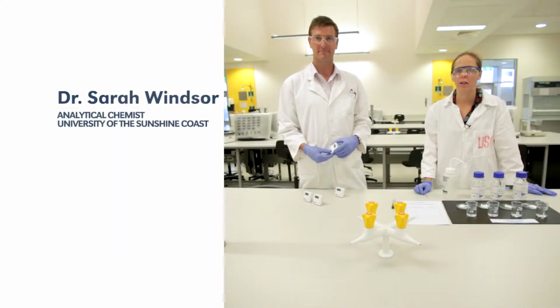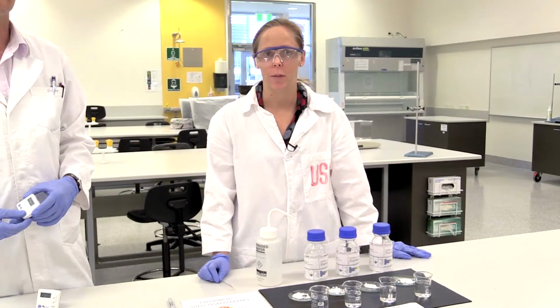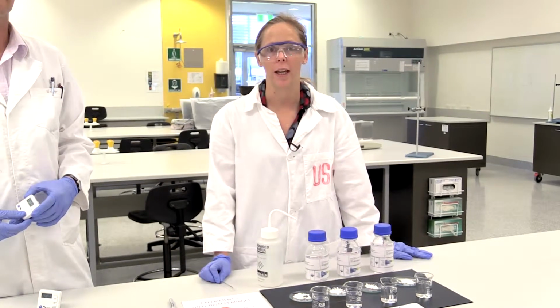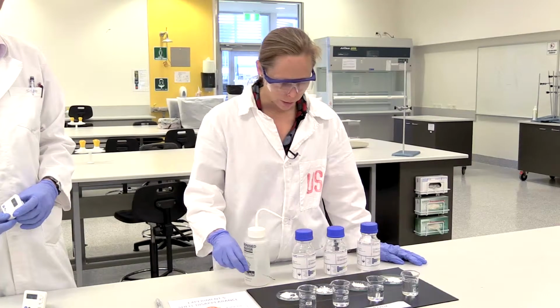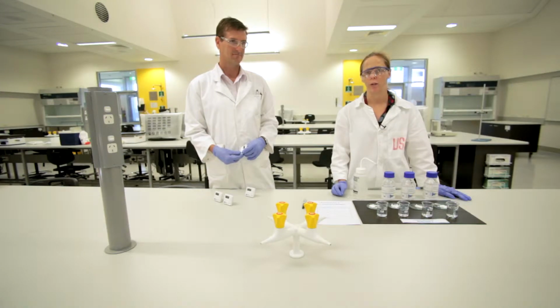So you saw in our ocean acidification example that putting the carbon dioxide into the water formed carbonic acid and turned our bromothymol blue indicator yellow. So what we're now going to look at is a consequence of ocean acidification. So what happens to those creatures in our oceans that have shells? So what we've got here is some calcium carbonate, and that's basically what most shells are formed out of.